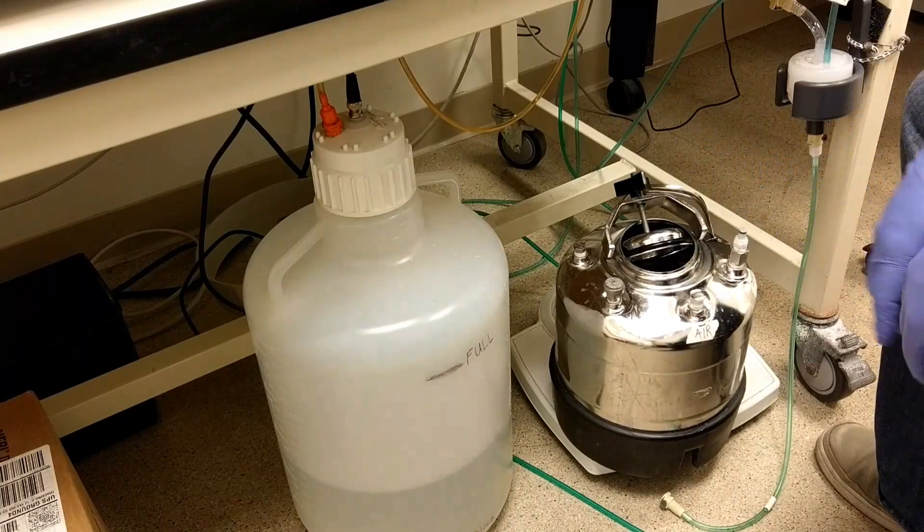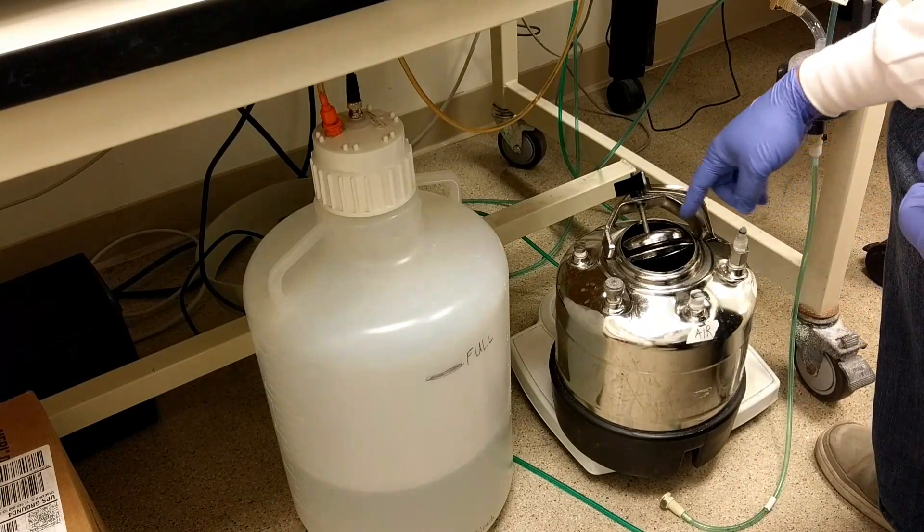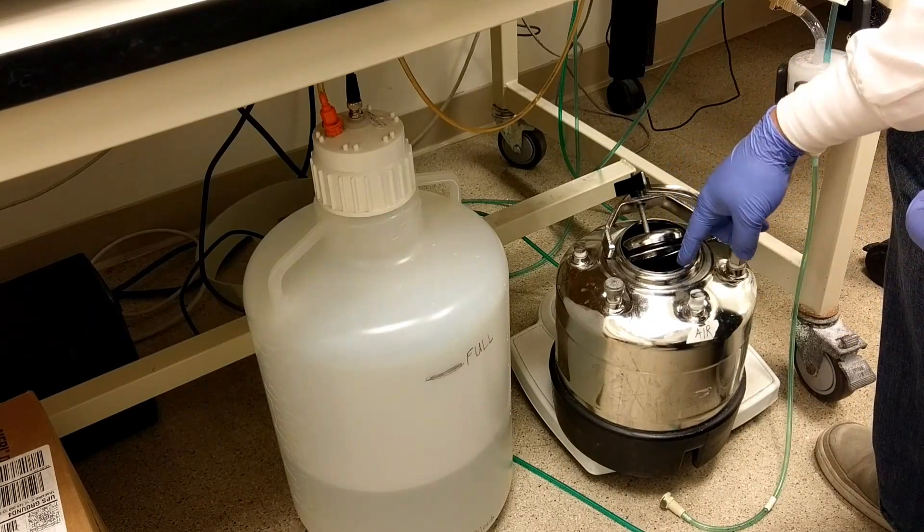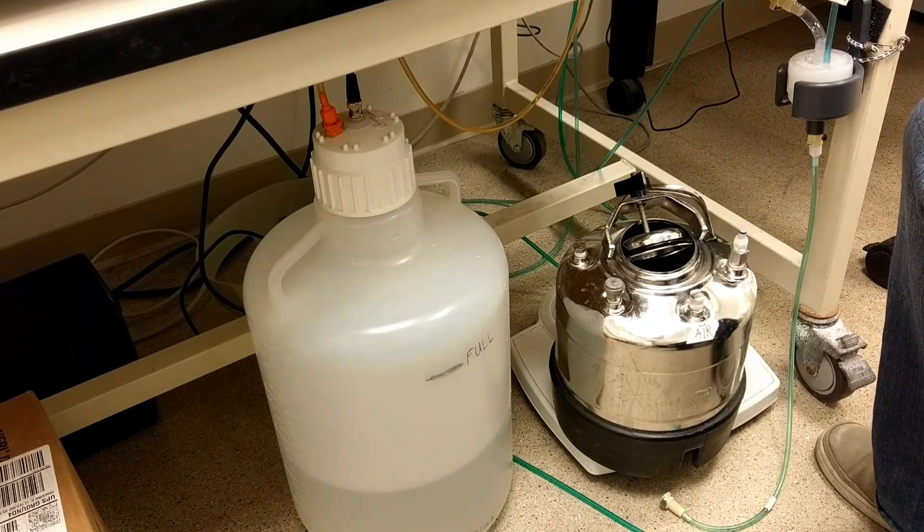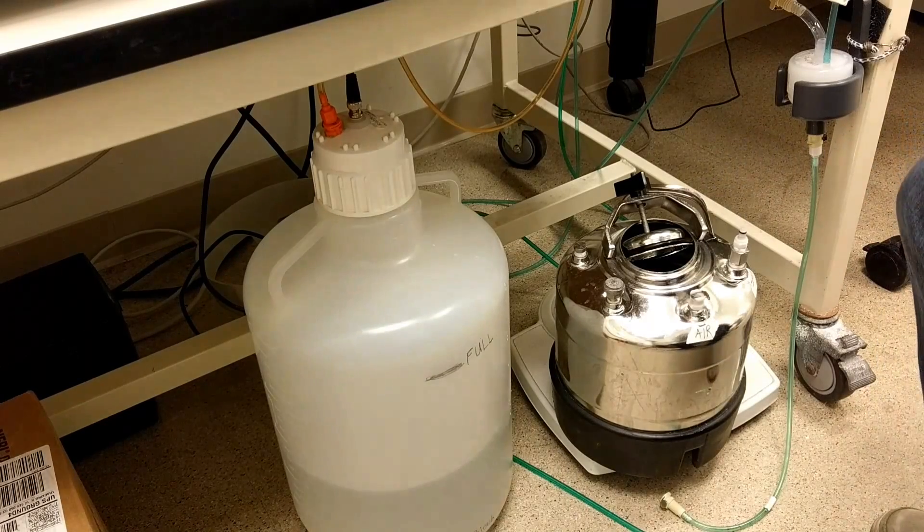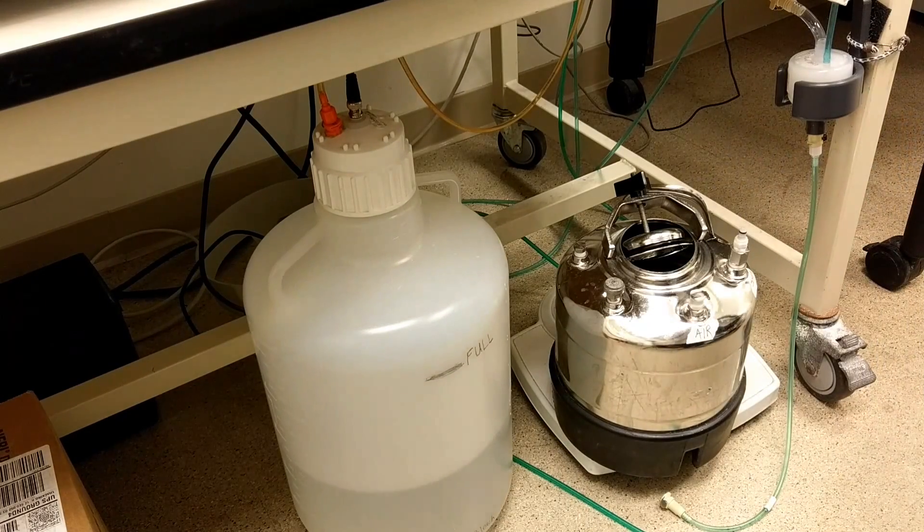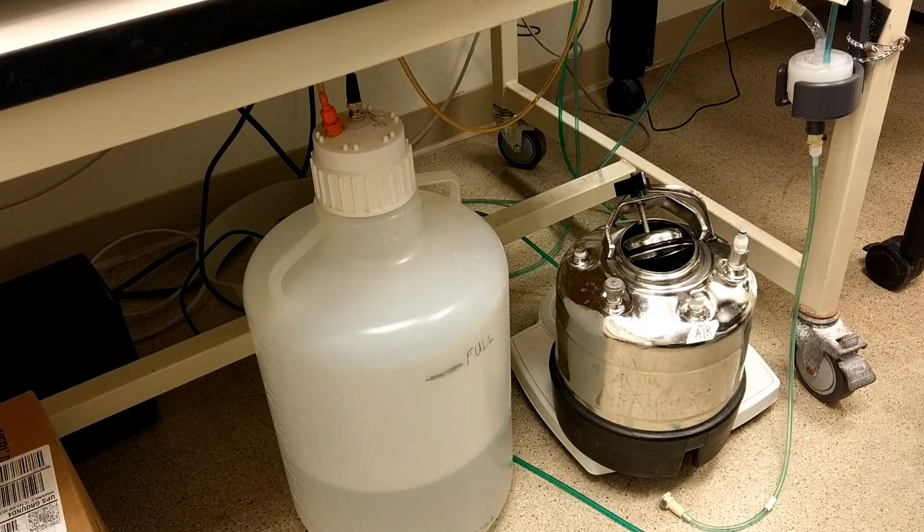You don't have to completely remove the lid. In fact, I don't recommend completely removing this lid. Just move it enough to where you can insert a hose to refill the tank, and there are a couple ways you can do this.